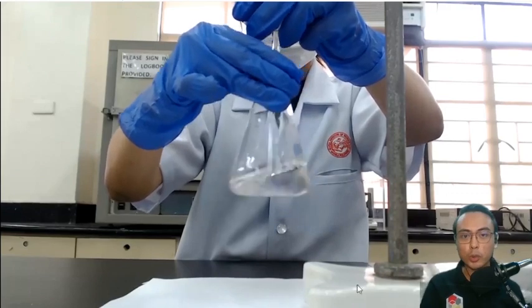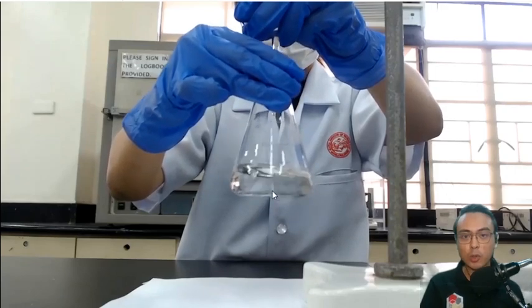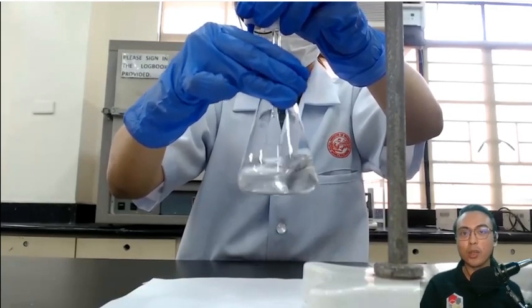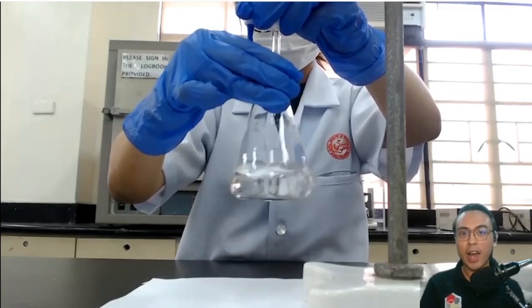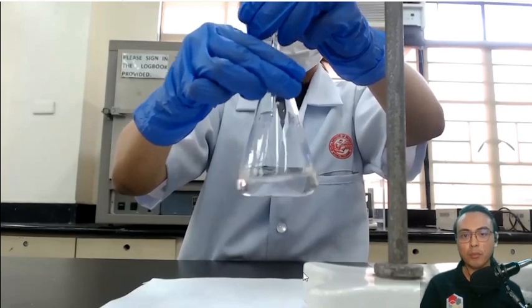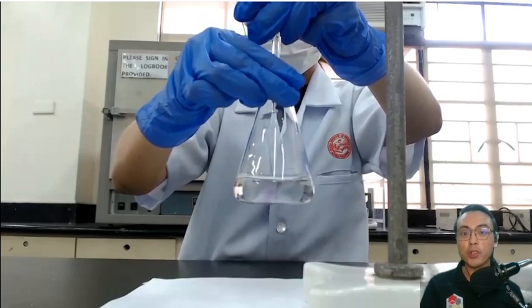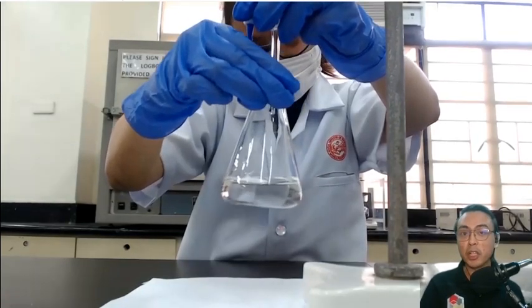Look carefully at the Erlenmeyer flask: as she adds a drop of the titrant the solution turns pink, but as she swirls the solution the color disappears. That's because the sodium hydroxide being added reacts with the acetic acid. The swirling of the flask is very important because it allows the sodium hydroxide to react with the acetic acid and ensures you are not adding too much titrant. The pink color is starting to appear but disappears — we want it to persist, and the titration is very near its endpoint.